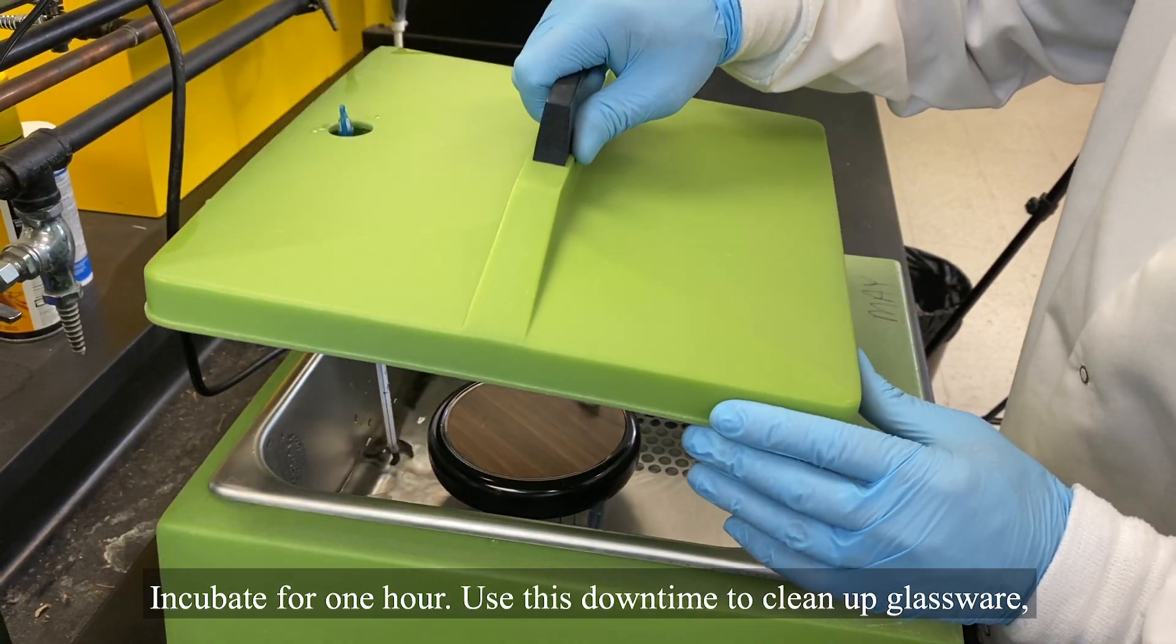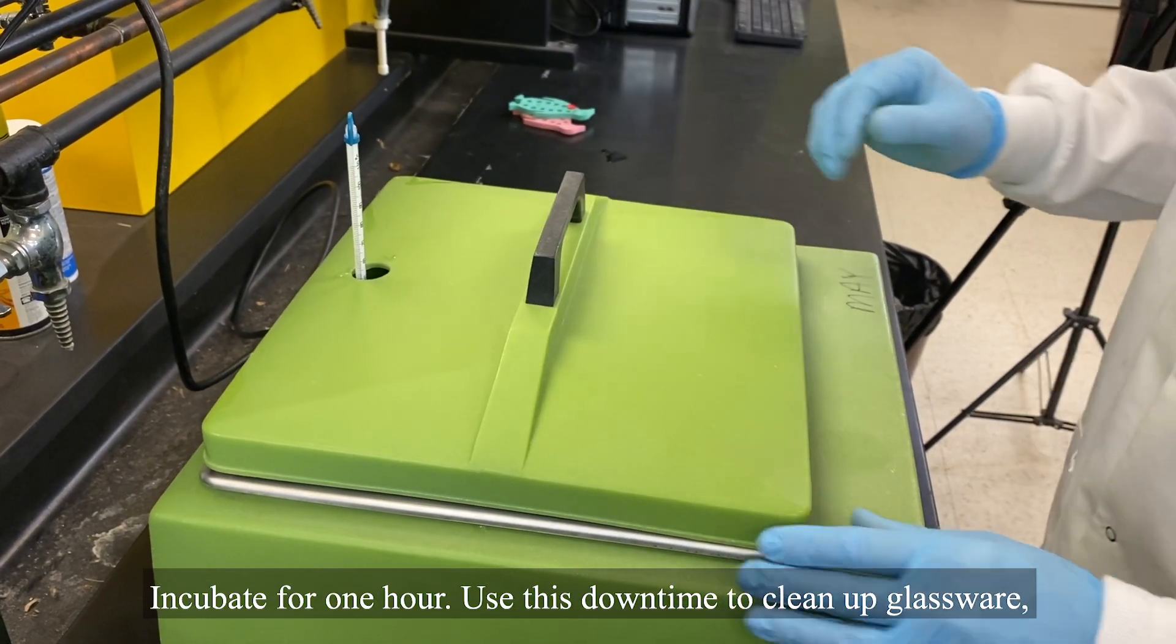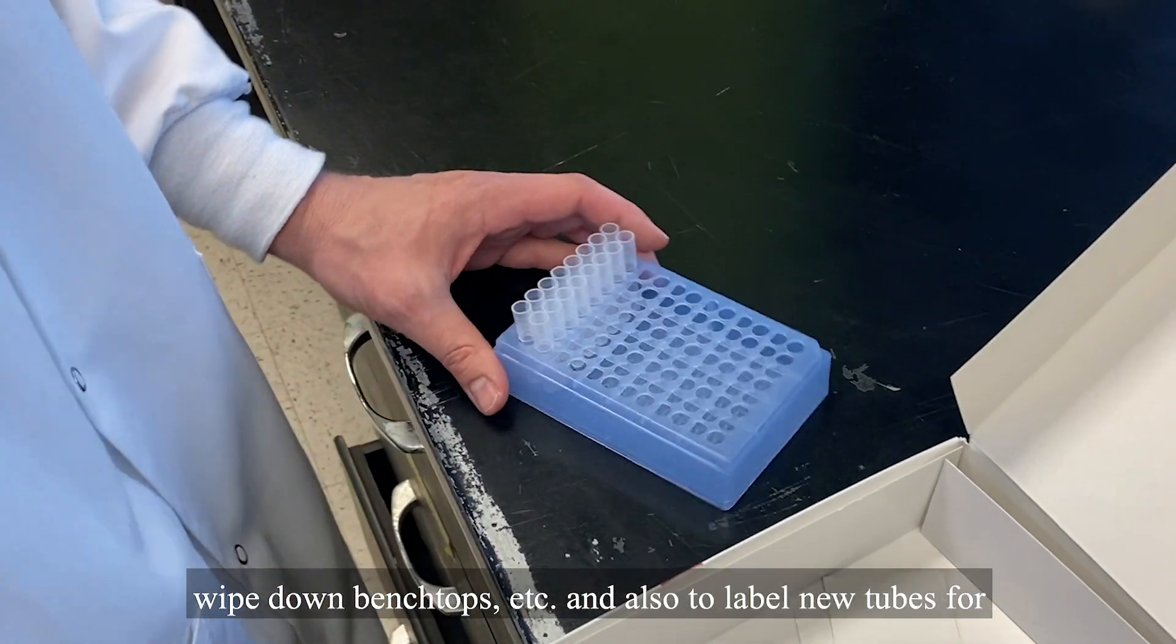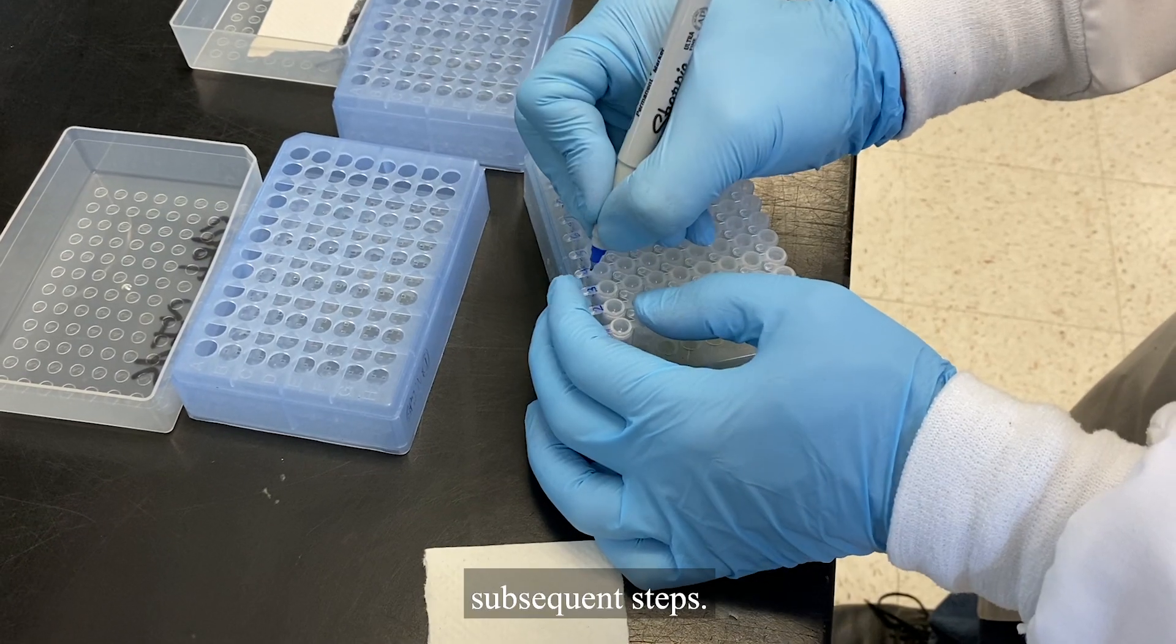Incubate for one hour. Use this down time to clean up glassware, wipe down bench tops, etc., and also to label new tubes for subsequent steps.